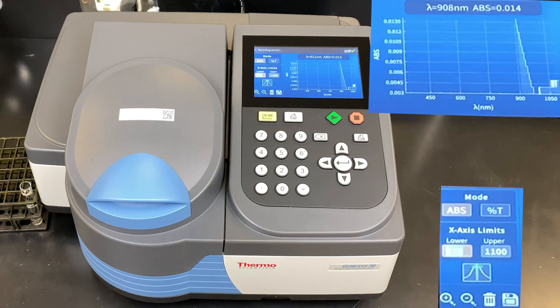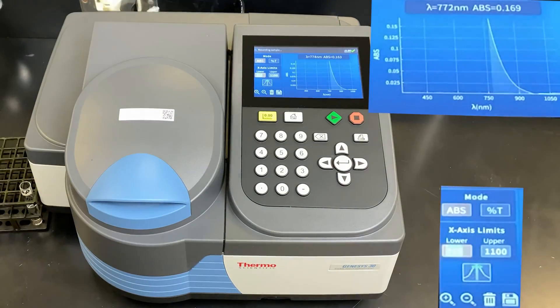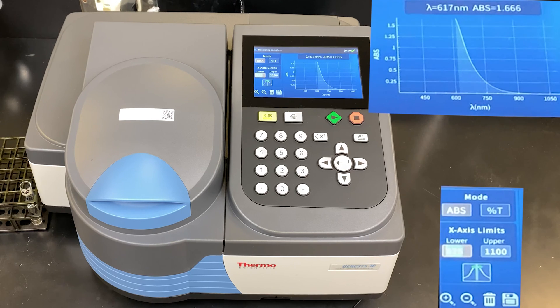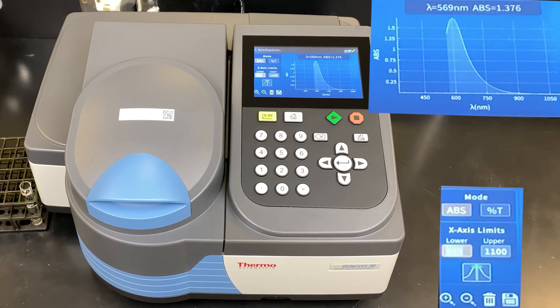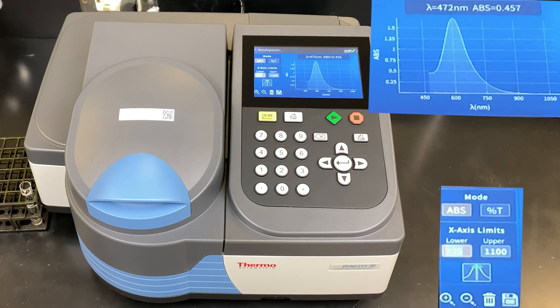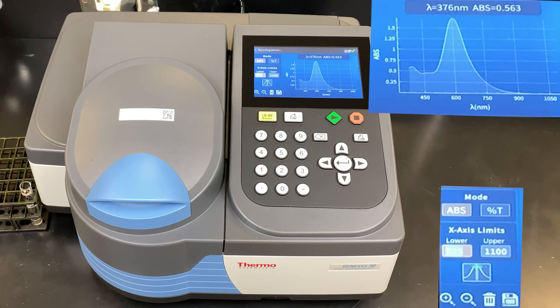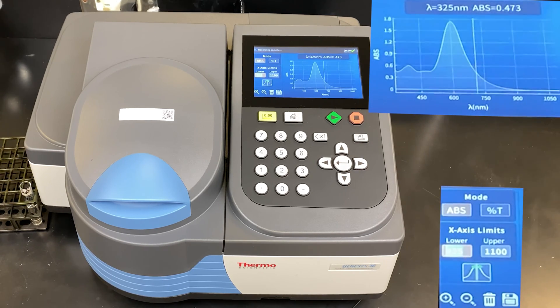You can actually see it graphing as we go along. These numbers are very small, so it looks like there's a huge change in absorbance, but really it's very minuscule. You can see the graph changing in real time — the vertical axis is changing as the horizontal axis gets smaller in terms of wavelength. It looks like we're getting close to our maximum absorbance. It now plateaus and then drops off — our maximum wavelength appears to be somewhere around 600 nanometers. It drops down, plateaus, rises slightly, plateaus again, then drops down. This appears to be the characteristic absorption spectrum for Janus Green B dye.